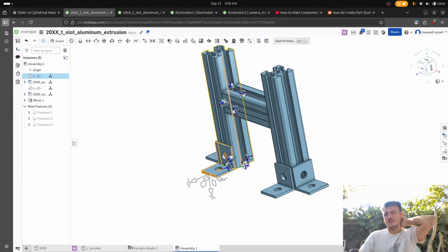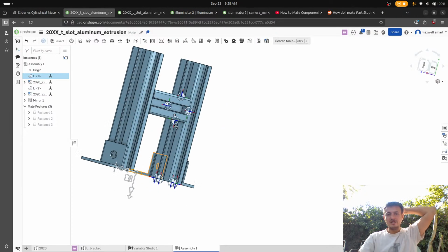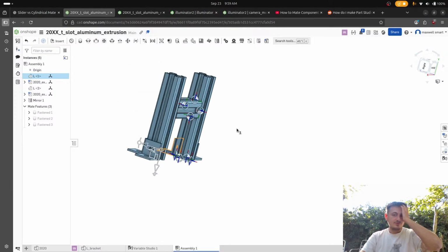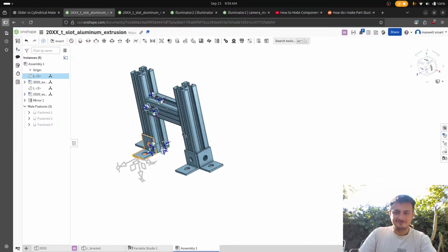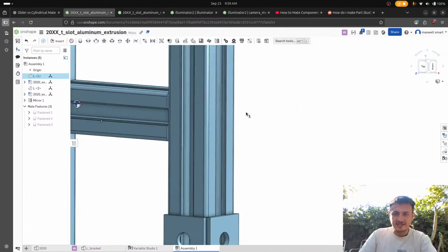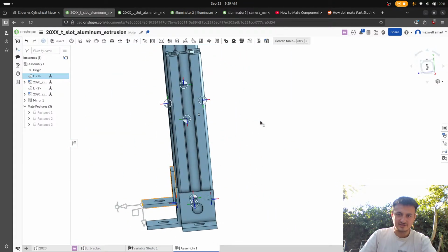We could just as easily have these pointing inward, but the biggest concern for me about this whole thing is, one, it's going to be super tall, so I'm going to have to build some way to mount the device onto the table. If I drop this camera, bro, my whole career is fucked. But the idea here is we're going to have this camera that sits flush facing down.